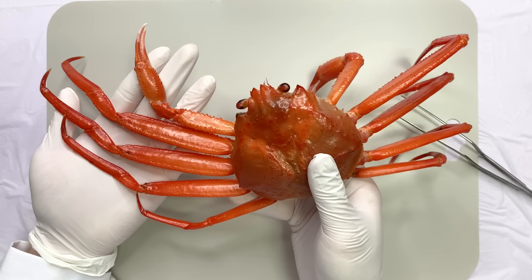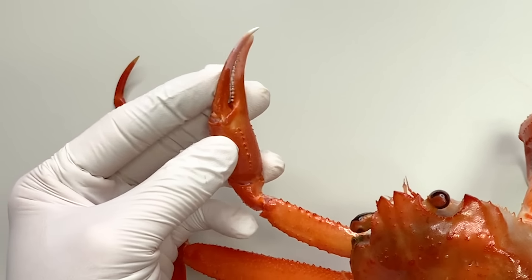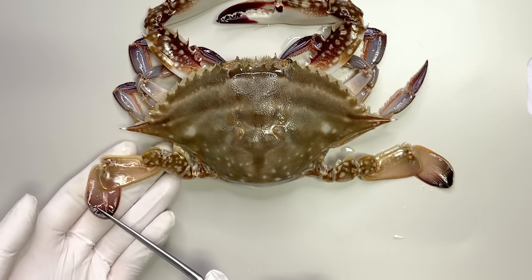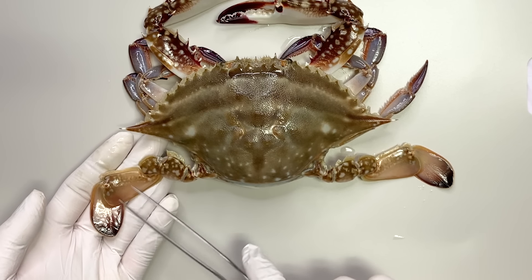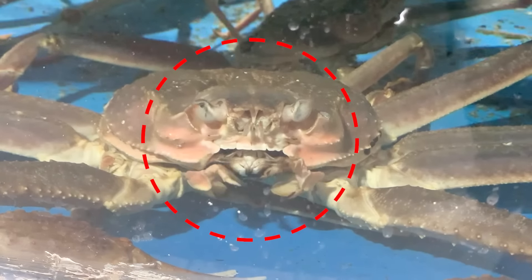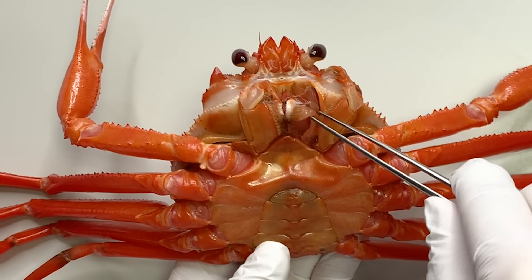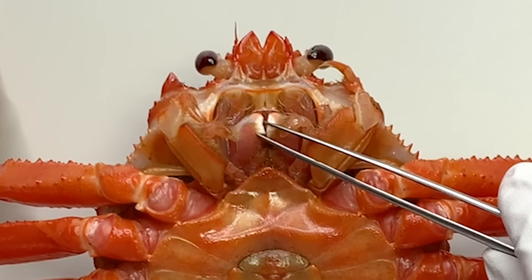Crabs have five pairs of legs. The first pair is the pincers, which are used for hunting or threatening. The remaining four pairs are walking legs, while some crab species have the fifth pair modified into swimming legs. If you look at the mouth area, you can see several moving appendages. There are multiple pairs of maxillipeds, which are used to manipulate food, and the mouth is located inside.